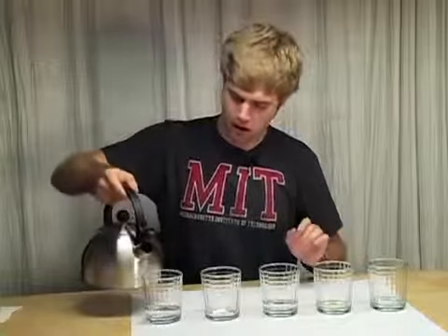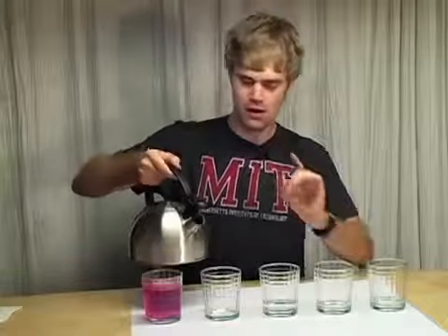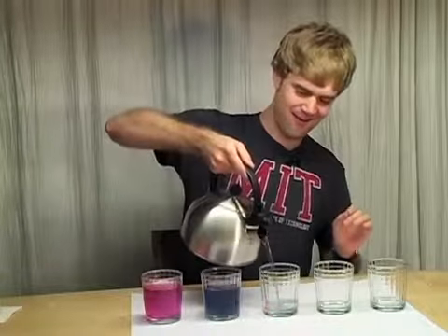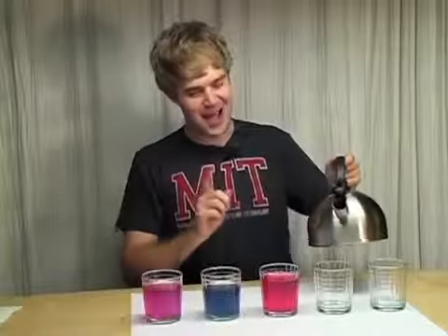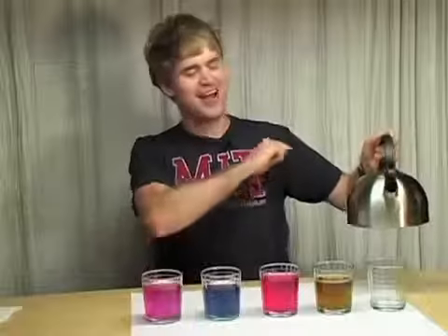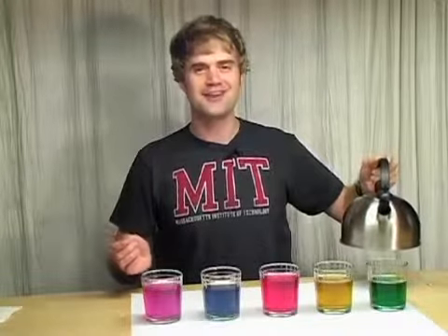Pink. Hey, not bad. Okay. Blue. Red. Okay. How about green? No, I mean yellow. And okay, and then green. So there we go, a rainbow of colors.